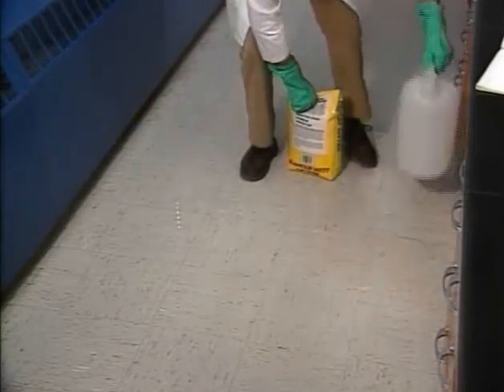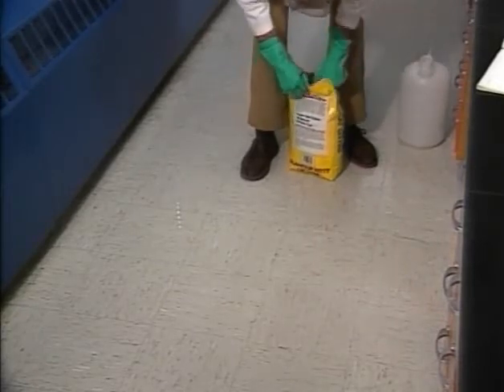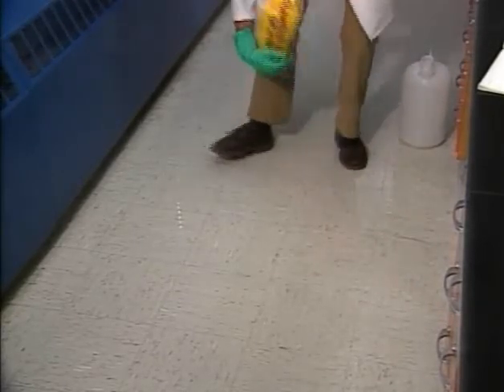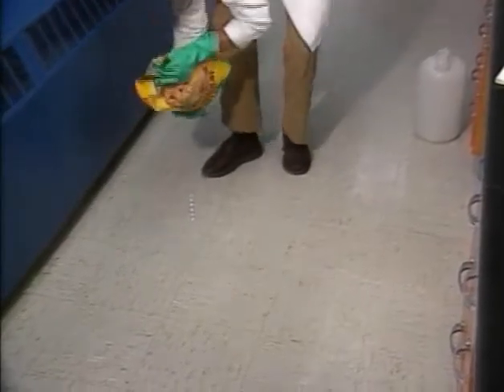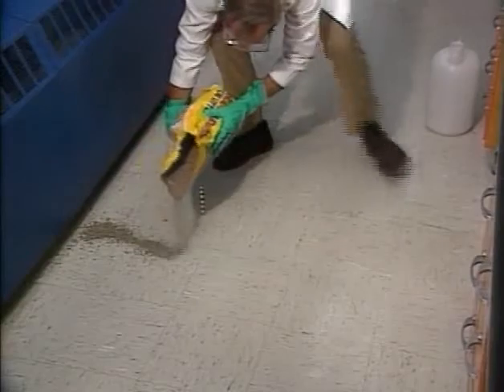At some point in your laboratory work, you'll probably spill something. You should report spills immediately, stay away from the spilled chemical, and let your teacher clean it up.